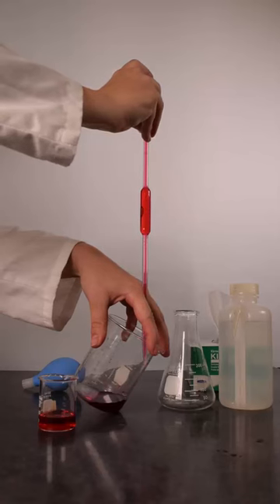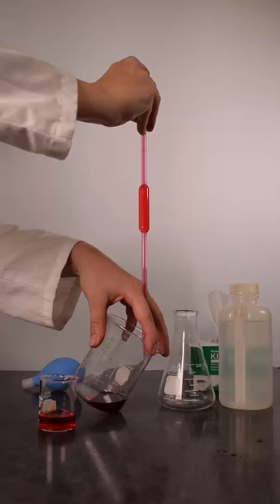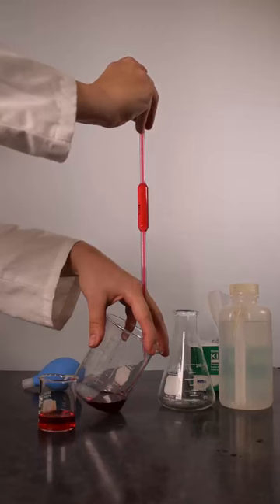Holding the pipette vertical, bring the meniscus to the calibrated mark while draining into a waste beaker. Stabilize the pipette with your hand that holds the waste beaker.